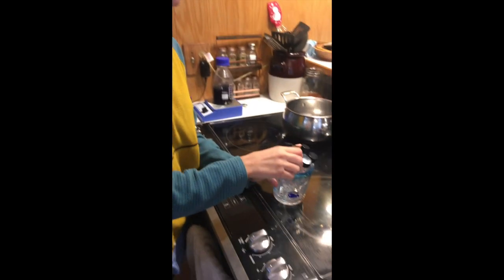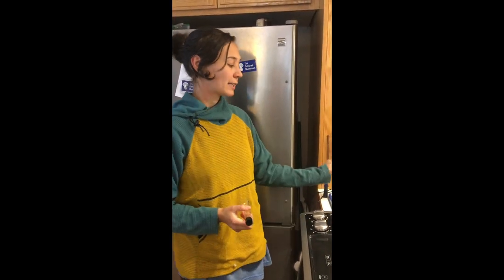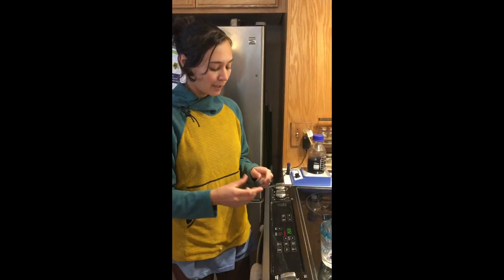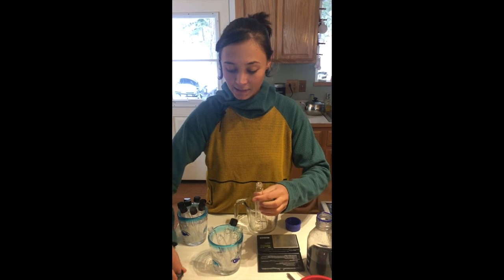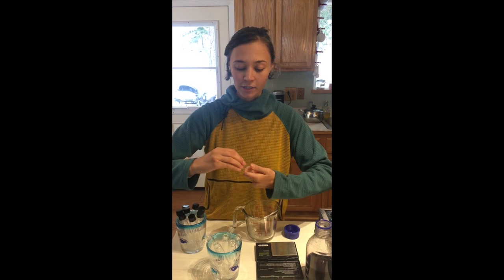What I'm gonna show you today is how we're gonna sterilize the whole test tube. Normally if I knew my test tubes were sterile, I wouldn't be pouring them and then sterilizing — I would just sterilize my agar bottle and then pour it into my tubes in front of the flow hood. But these test tubes have been in storage for a while, so I can't say they're sterile, so we're just gonna sterilize them along with the agar.